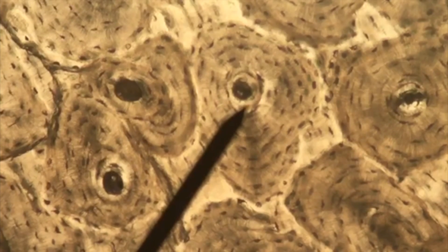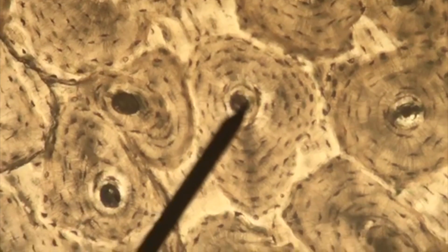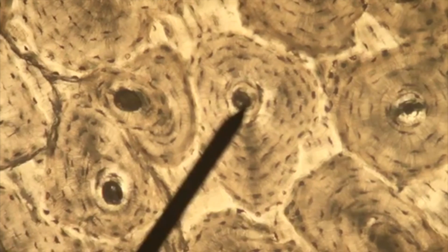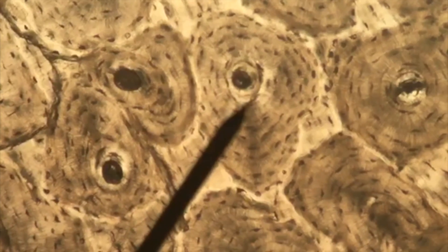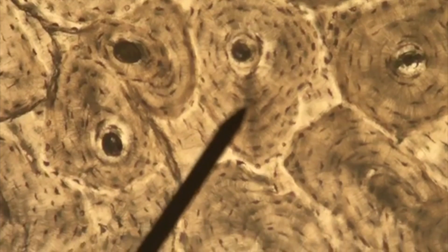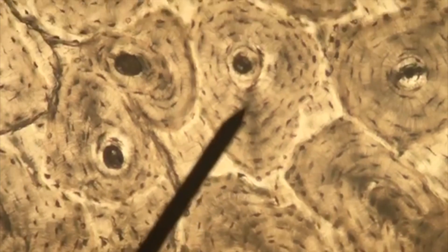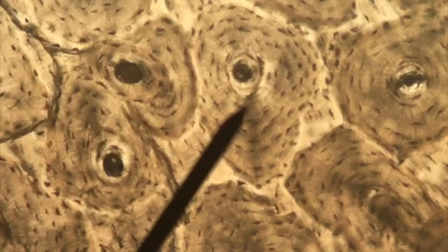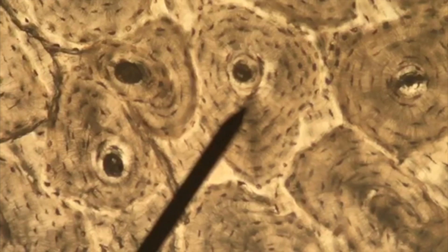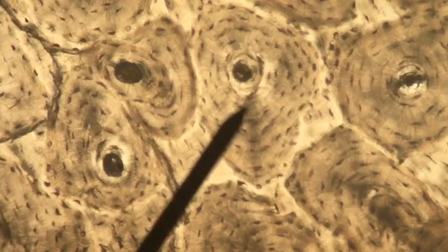The last slide we're going to look at is a portion of our supportive connective tissue, which is compact bone. Our trigger word for this is 'trees' — this looks like a tree that has been cut down, comprising concentric rings. The pointer is in the darkened section called the Haversian canal or central canal. Surrounding that central canal are a bunch of concentric rings called lamellae. At the margin of each lamellae is a divot called a lacunae. Within those lacunae are specialized cells that maintain the bone, called osteocytes. Stretching out from those lacunae are canaliculi.